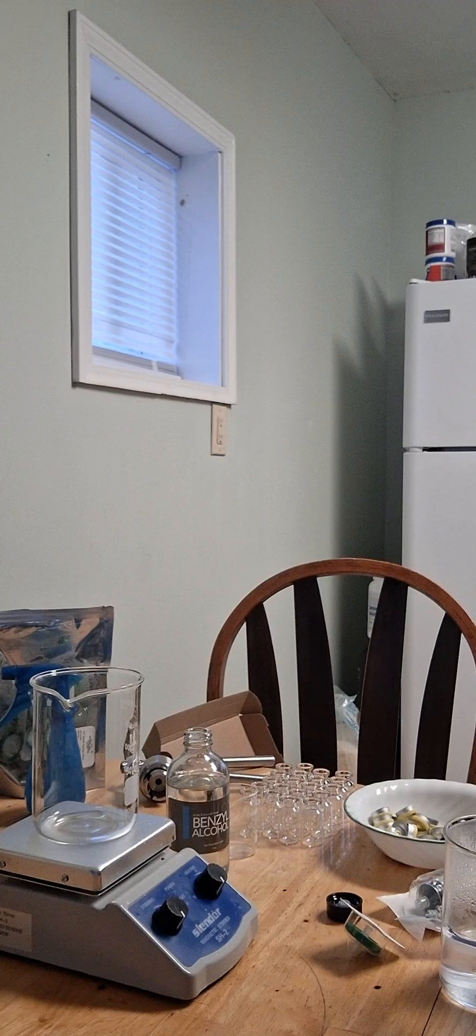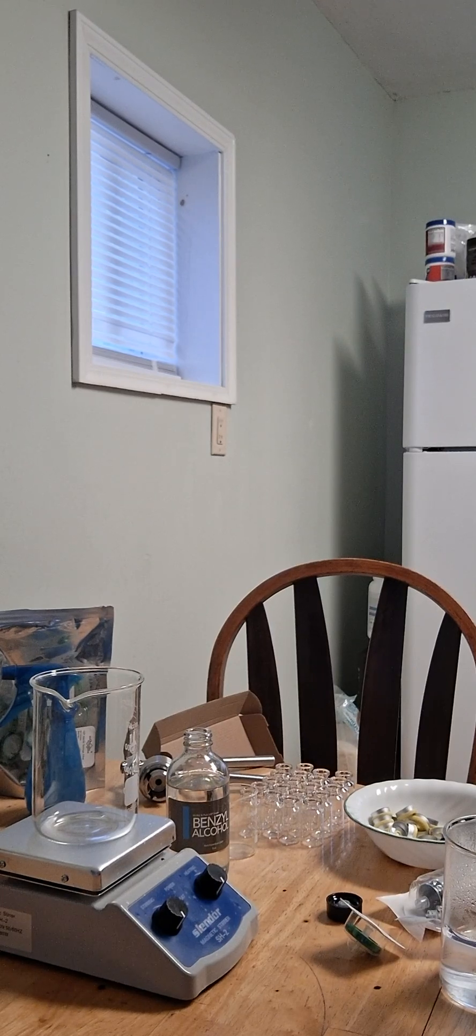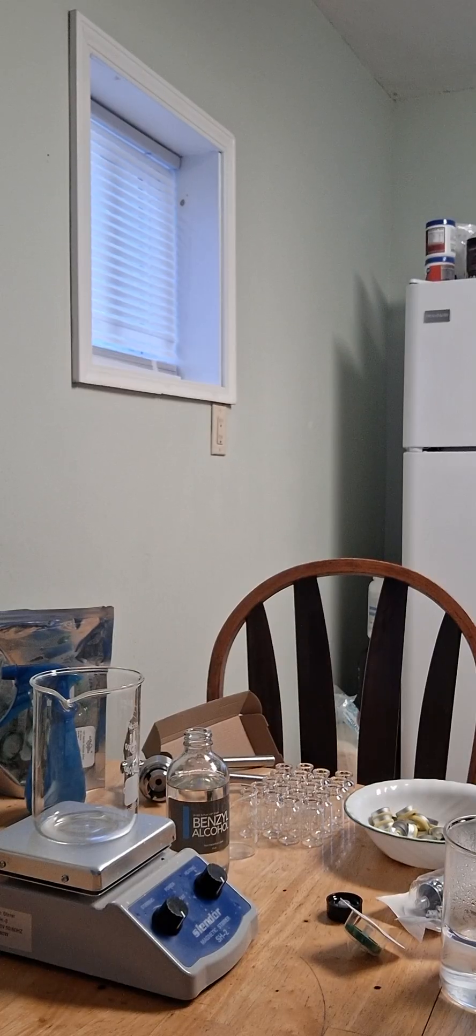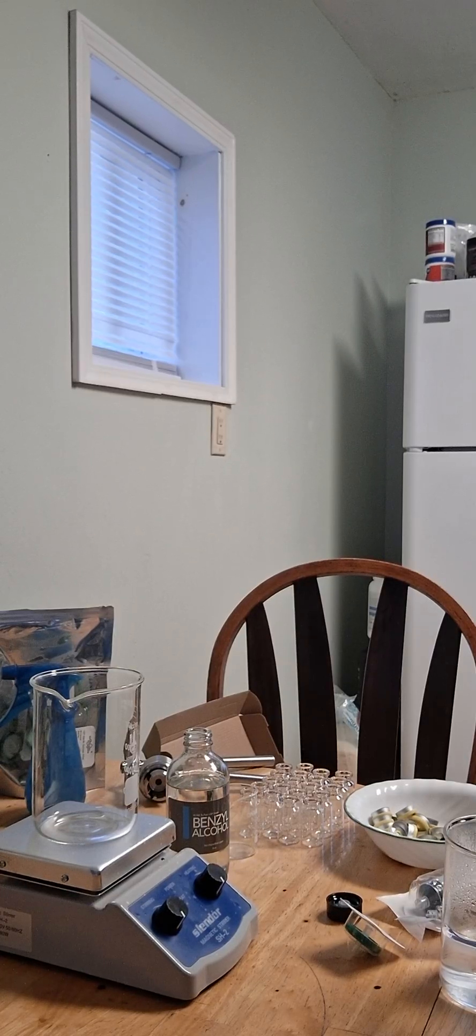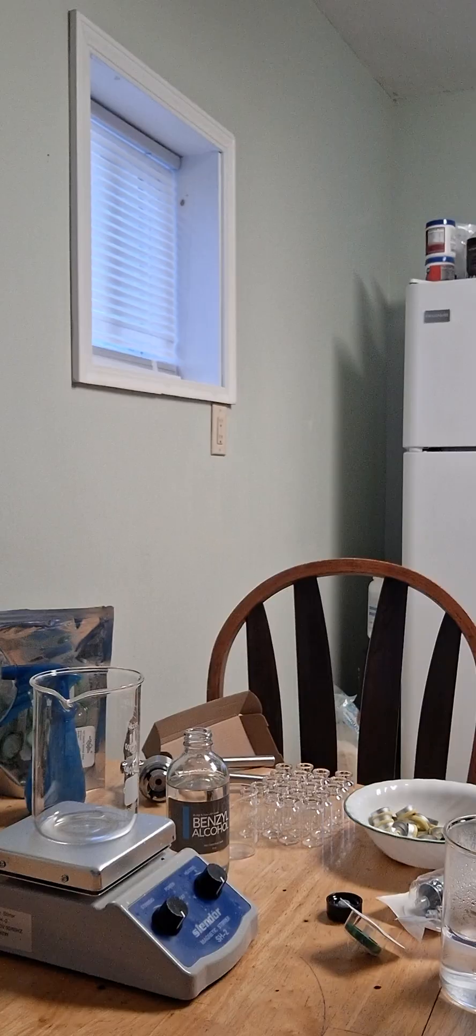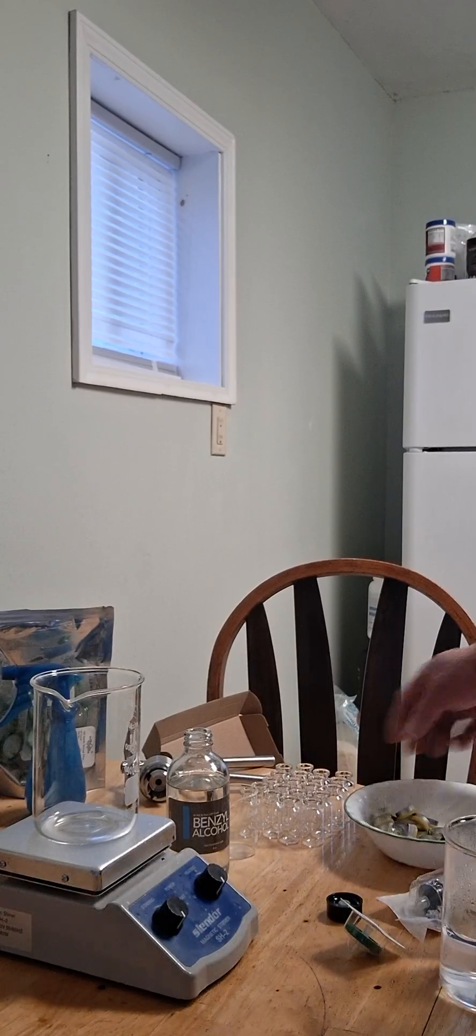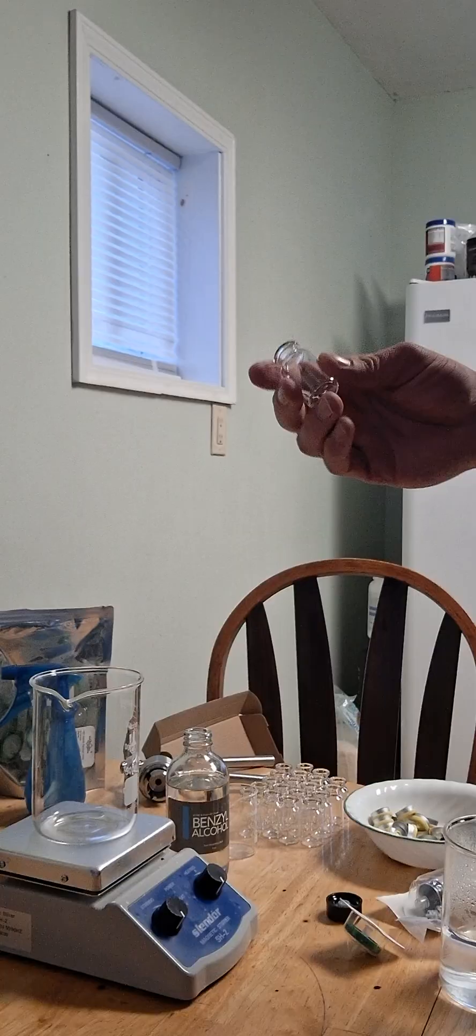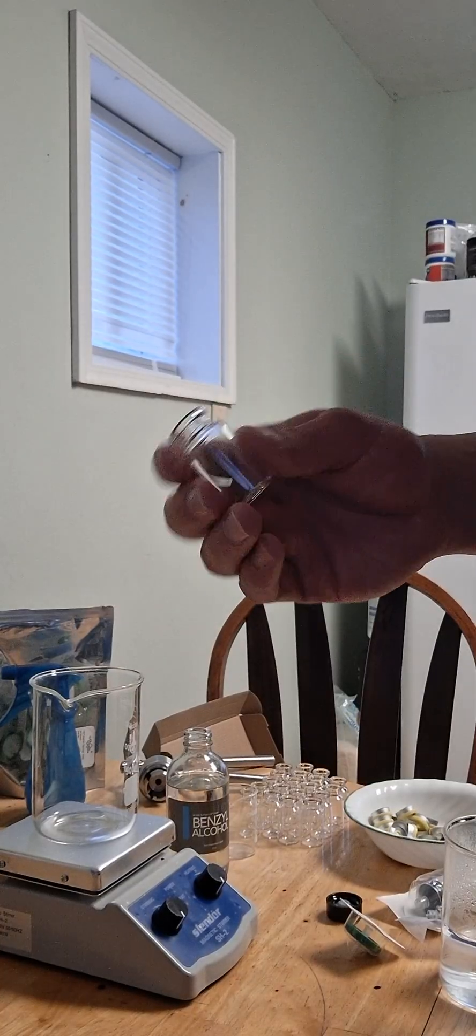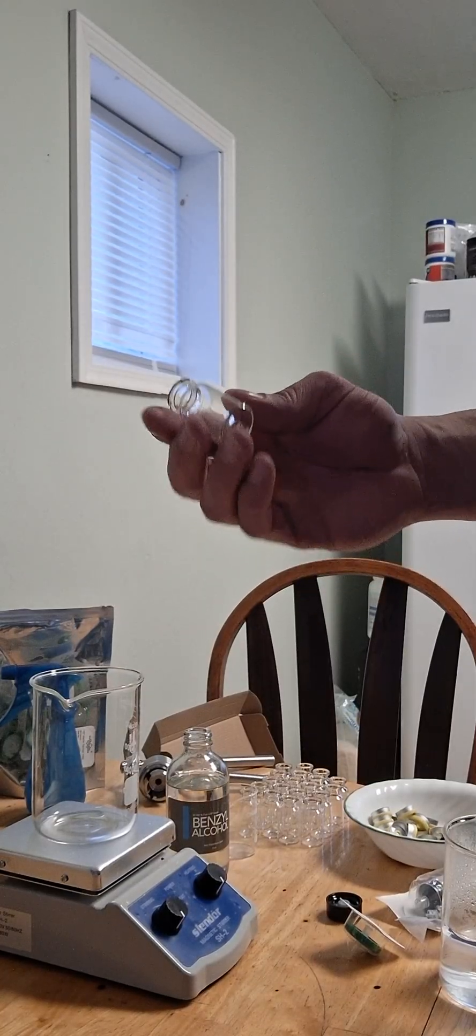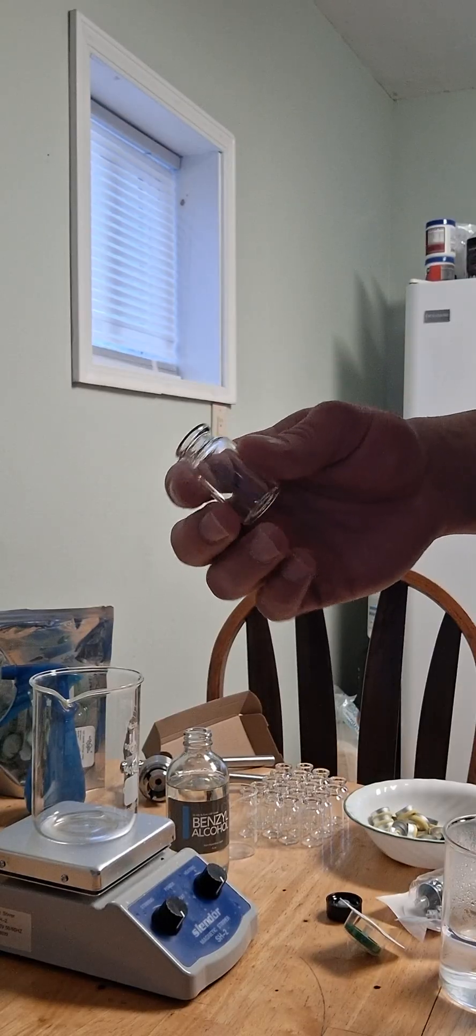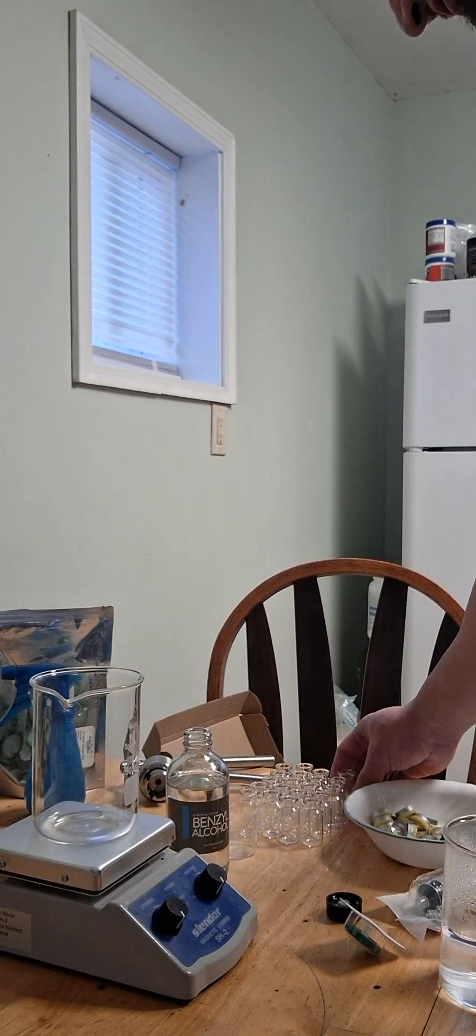You will need distilled water and benzyl alcohol, which you can buy off of Amazon. I think that was twenty dollars and an eight ounce bottle is enough to make two thousand three hundred and sixty ten milliliter vials, so you would have enough for basically the rest of your life. Also, you can buy pre-sterilized vials on Amazon that are already sealed. I am making multiples, so I have just sterilized these myself with a pressure cooker.